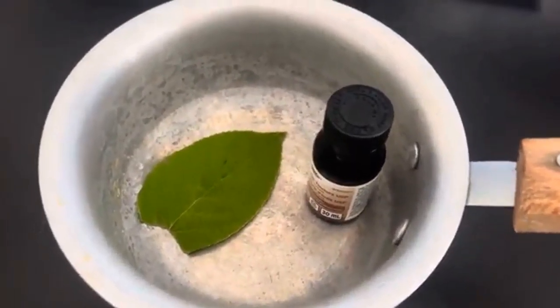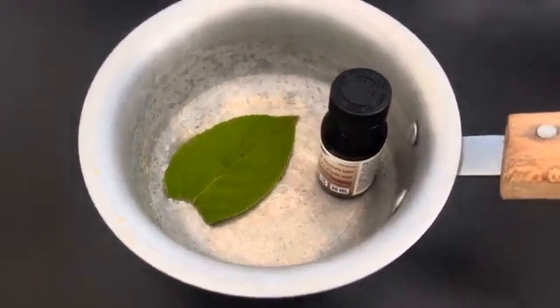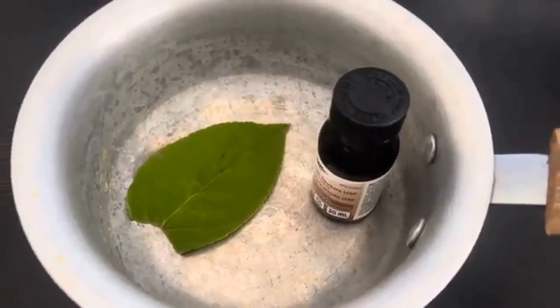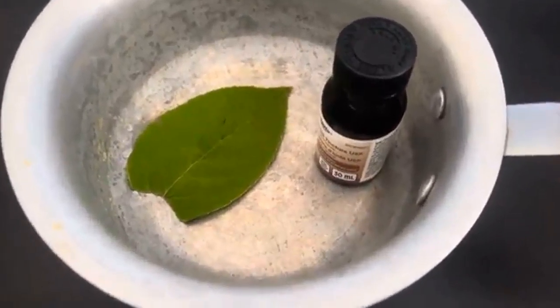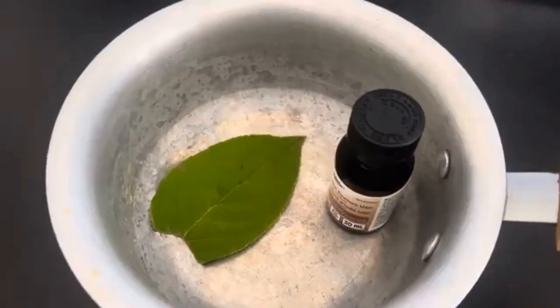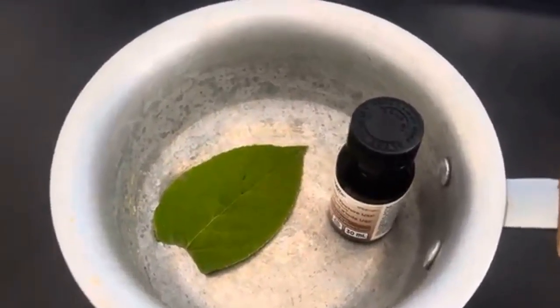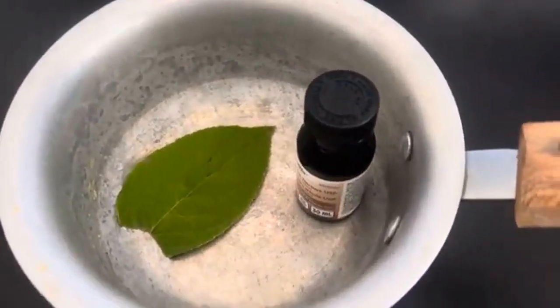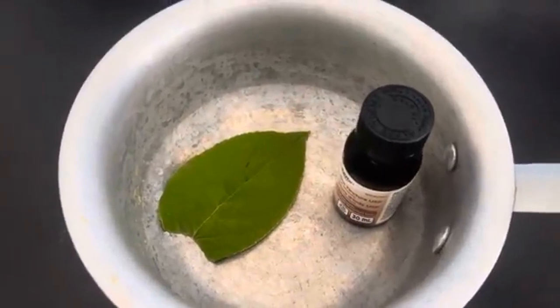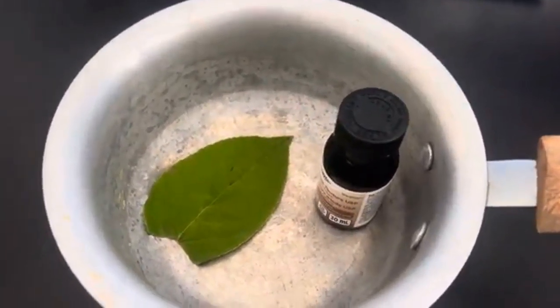For the experiment itself, the procedure goes as follows. First, we obtain a leaf, which we've already done. We fill up the small pot with water, heat it up, put the leaf into the water, and let it boil. During the experiment I will explain what the point of each step is. Eventually the water will go green as the chlorophyll is boiled out, and the leaf will become frail and almost discolored. At that point we take the leaf out, add our iodine solution, and observe what happens.